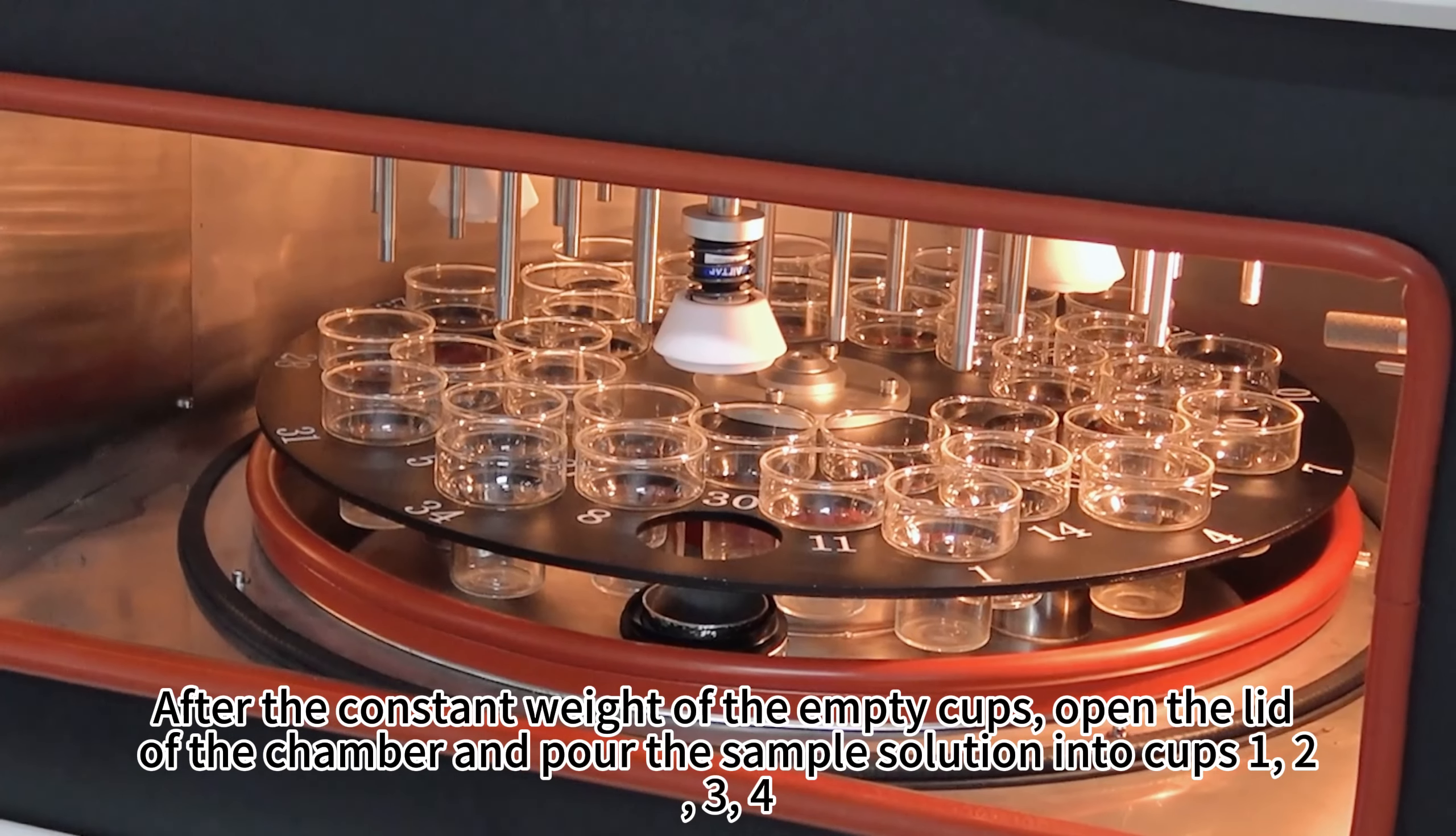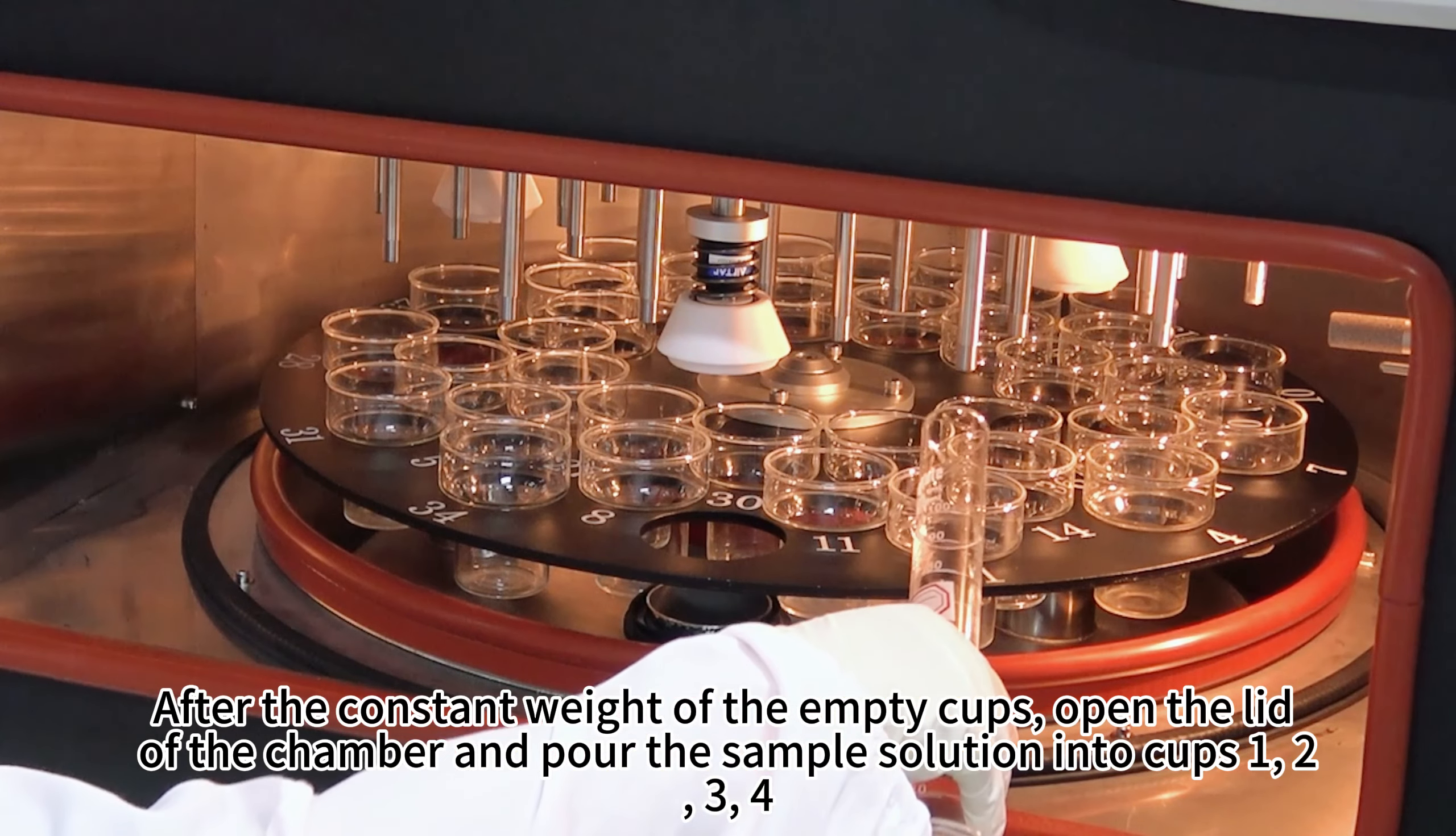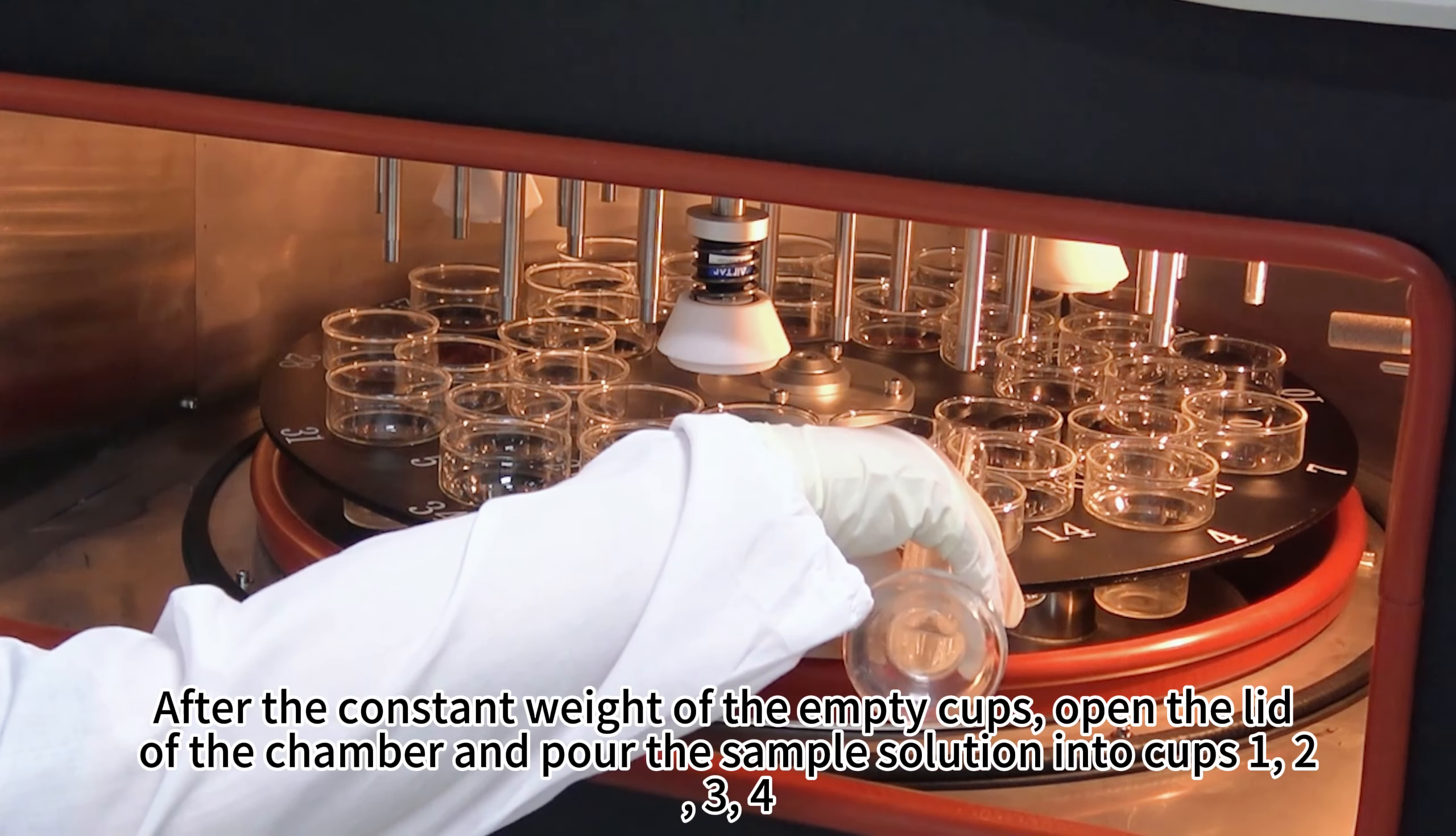After the constant weight of the empty cups, open the lid of the chamber and pour the sample solution into cups 1, 2, 3, 4.